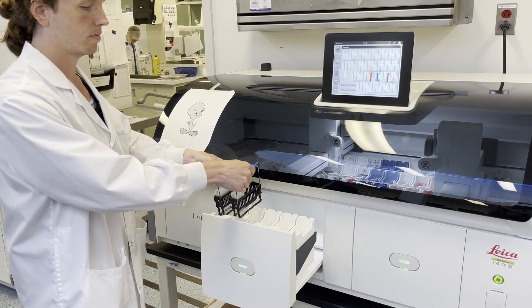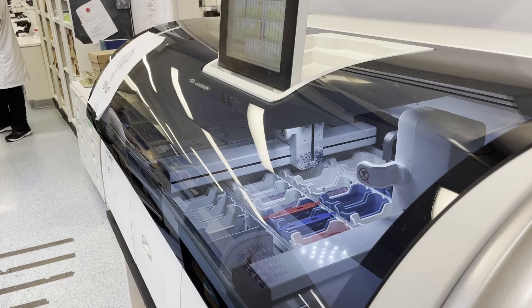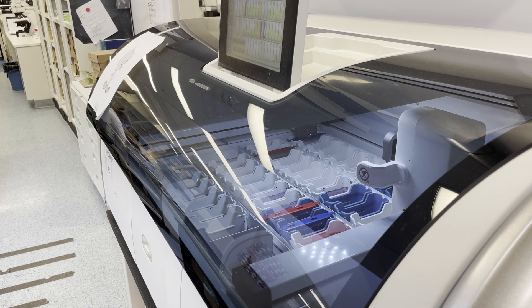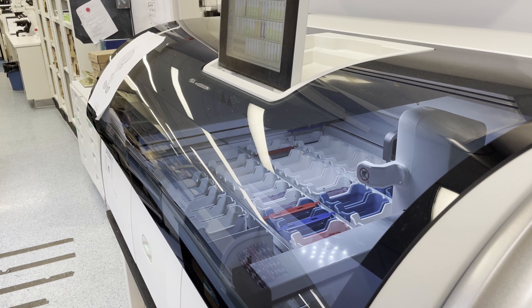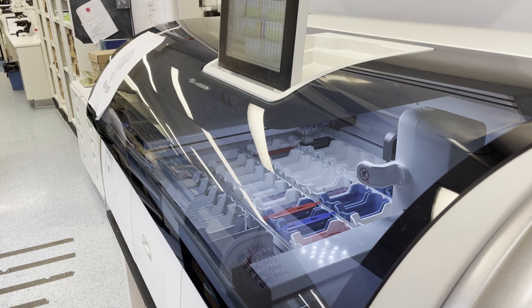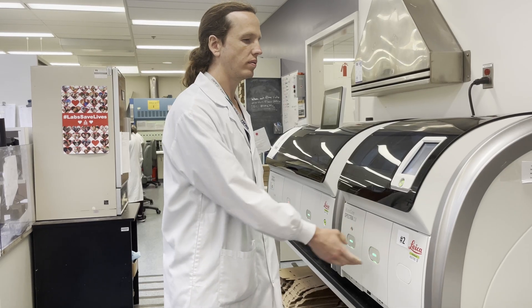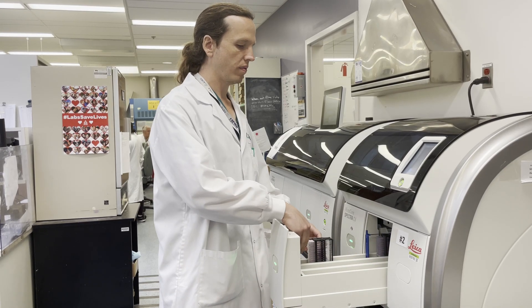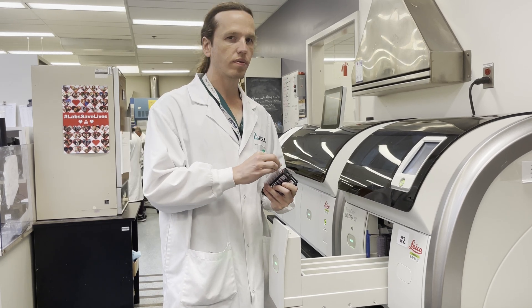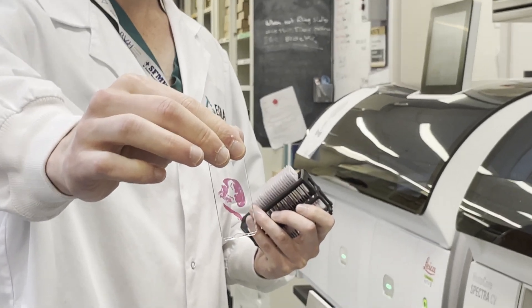Next, the glass slides are moved to a machine that applies a combination of stains called hematoxylin and eosin, or H&E, to the tissue. This combination of stains is designed to stick to tissue and allow pathologists to see microscopic features that would be invisible in unstained tissue.